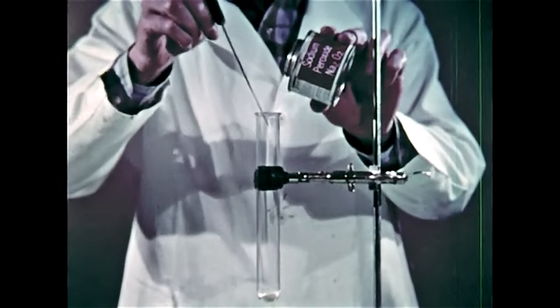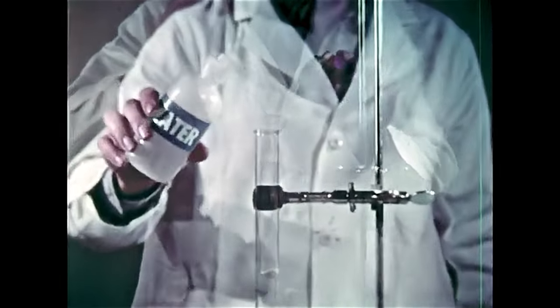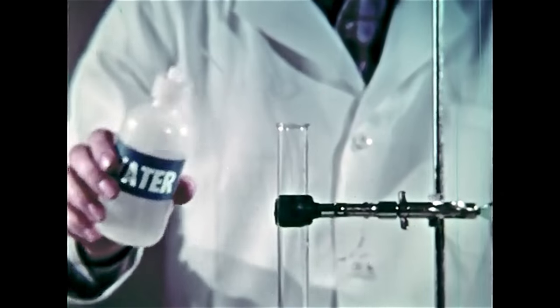A number of these are convenient sources of oxygen in the laboratory. When water is added, the reaction starts immediately.